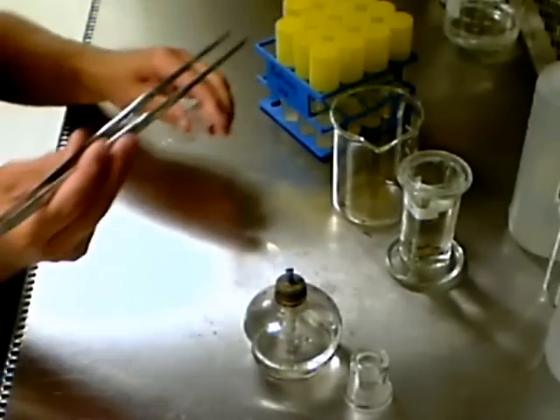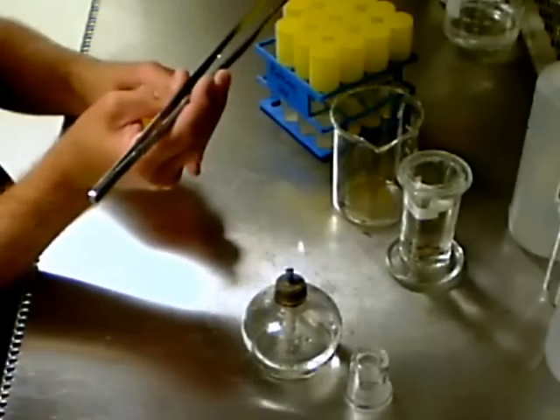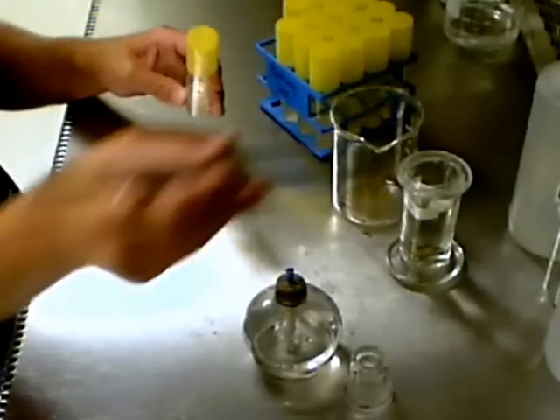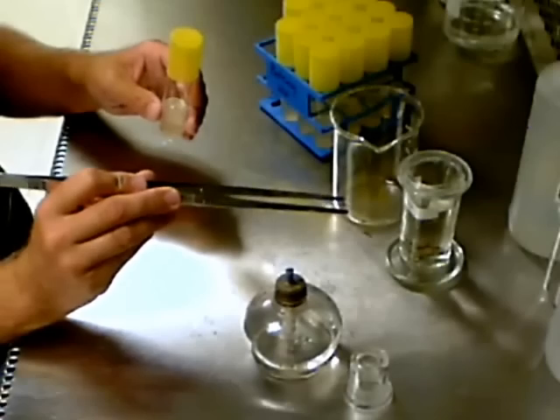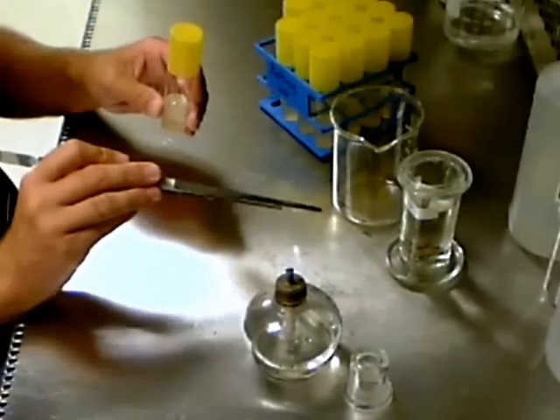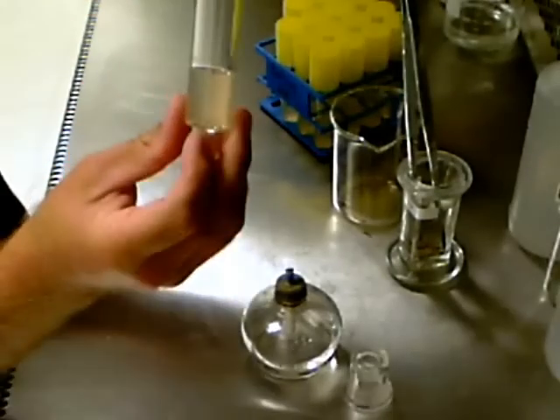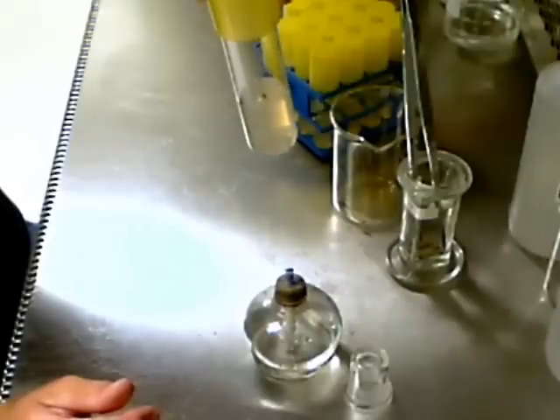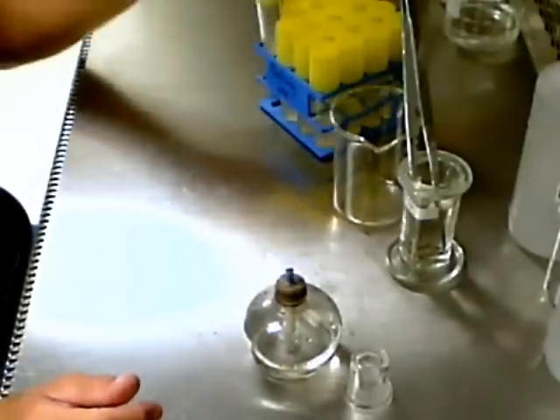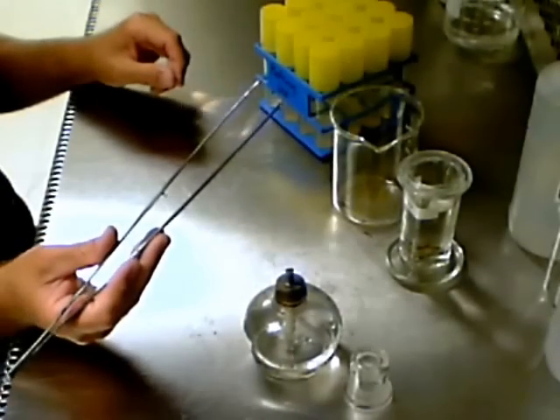Take a culture tube from the rack and remove the lid, holding it between your pinky finger and palm rather than placing it on the surface of the hood. Gently wipe the surface of the agar with the forceps to lay the seed on top of the medium and press the seed gently to make sure it is in good contact with the agar. It does not need to be submerged beneath the surface of the medium to germinate. Replace the cap, flame the forceps once again, and place the culture tube back in the rack.